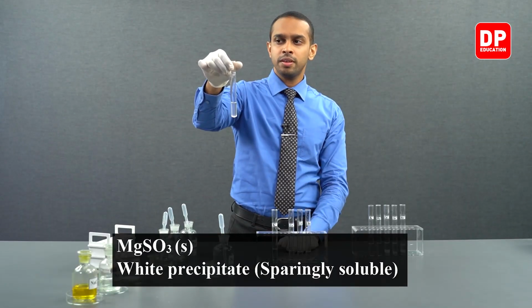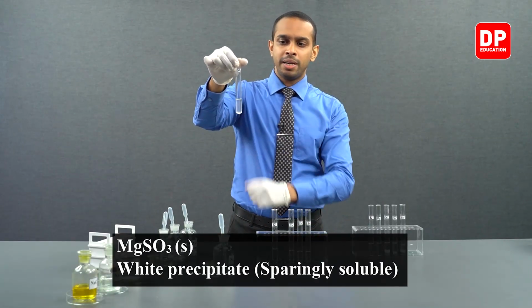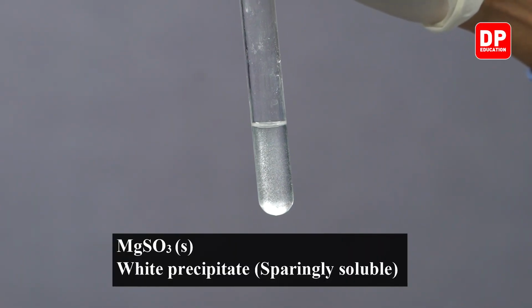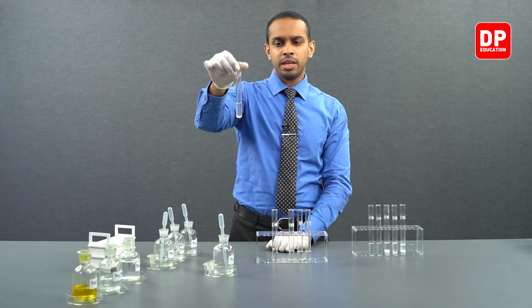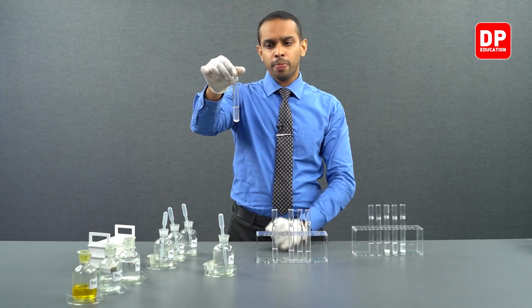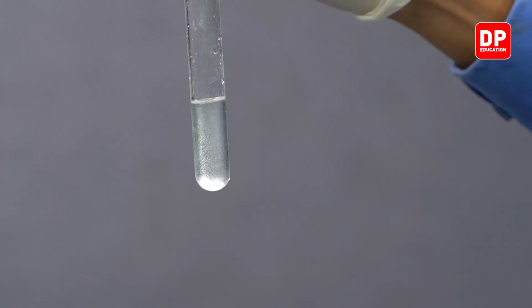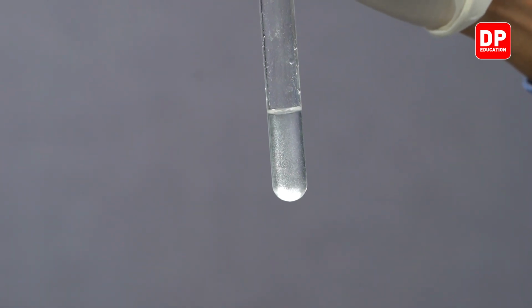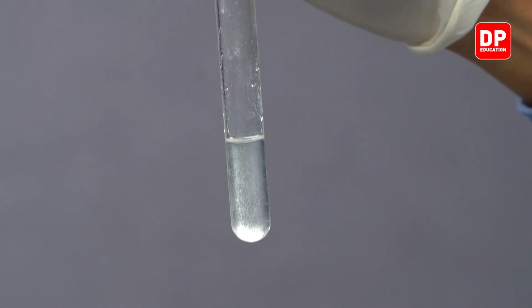You can observe the precipitate particles suspended in the aqueous medium very clearly now. If we set it aside for a while, you will be able to notice the precipitate collecting at the bottom. So when we are doing the summary for this part of the practical, you will be able to observe the precipitate a little bit more clearly.